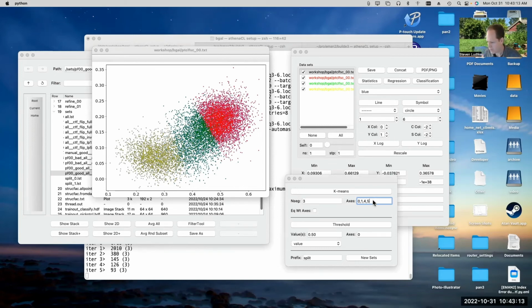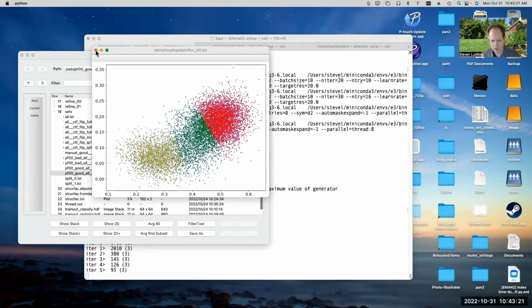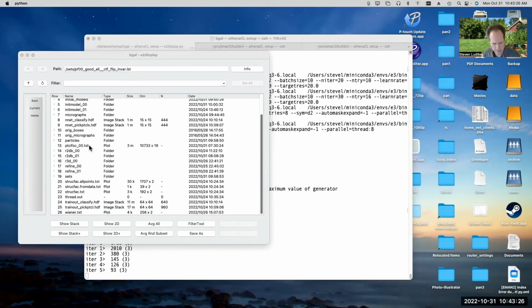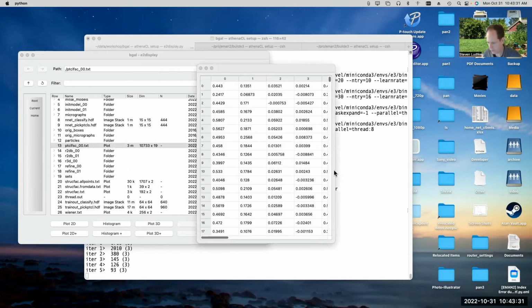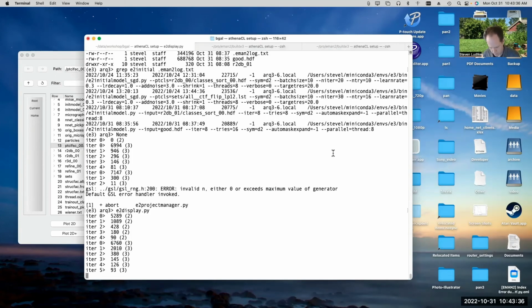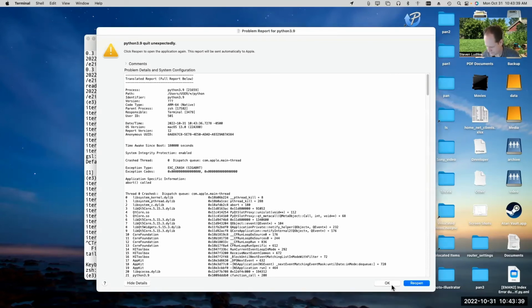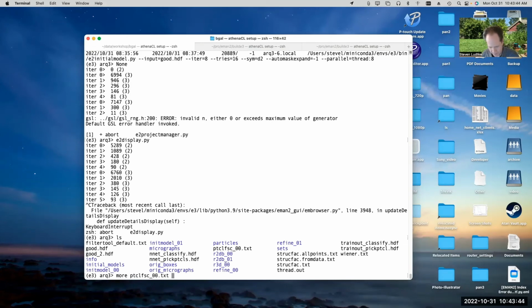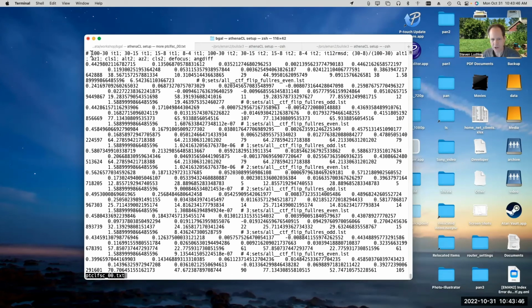Gotcha. So the actual thing the program uses isn't just 0, 1, 4, 5. It actually uses some of the other columns that I didn't talk about as well. If you look at that text file, where is it? There we go, that one. If we look at that text file itself, oh, sorry, it strips the labels off the top. Let's do that. At the top, it has a set of labels which tells you what it's got.